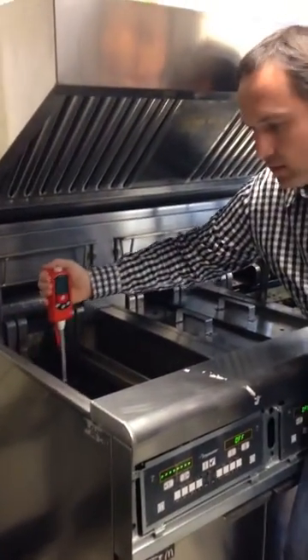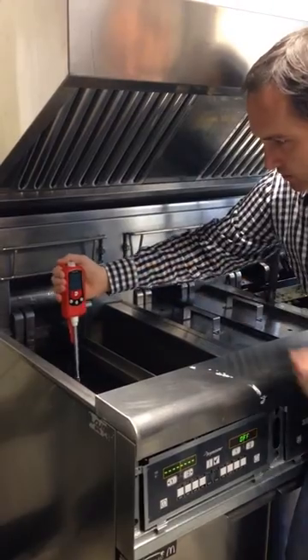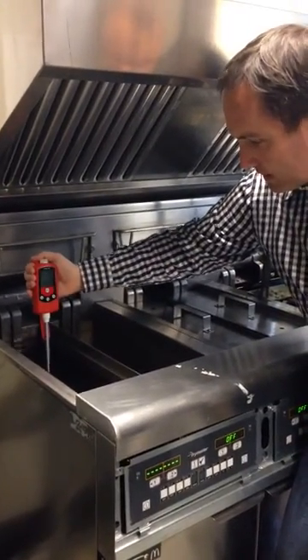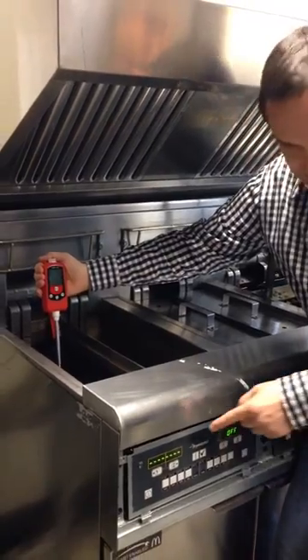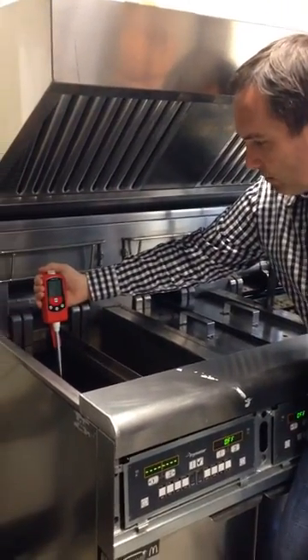The flashing value says it's not stable anymore. You have here the temperature, it's about still 170 degrees. So the fryer has 170 degrees, I can hold it.